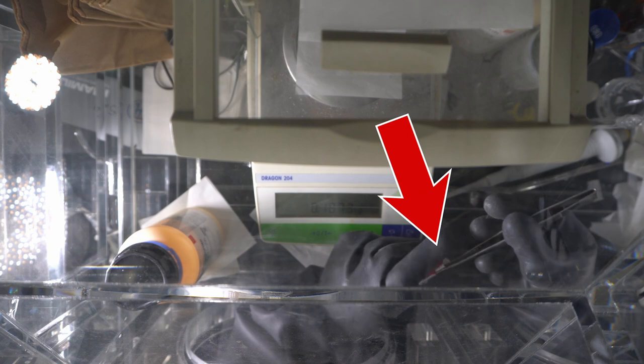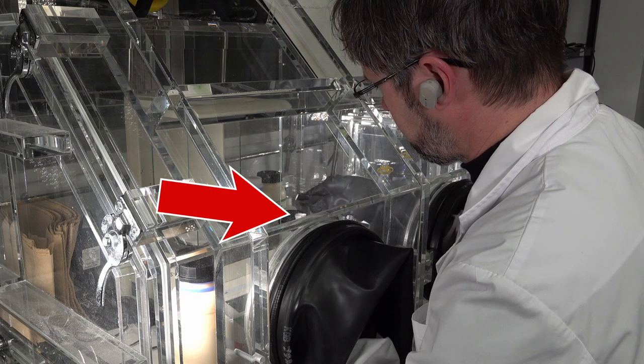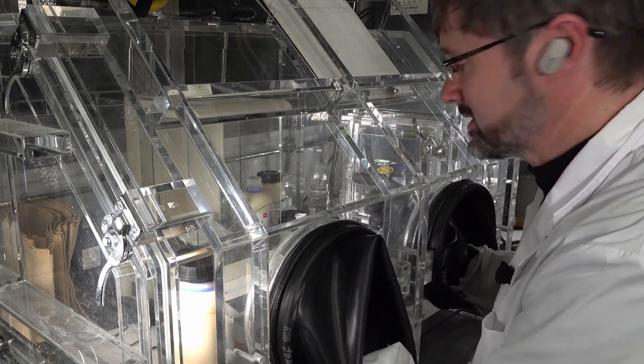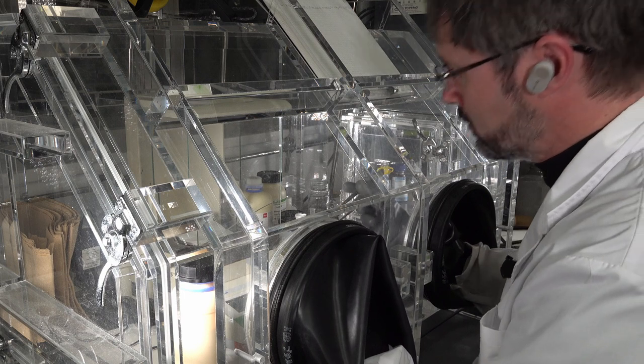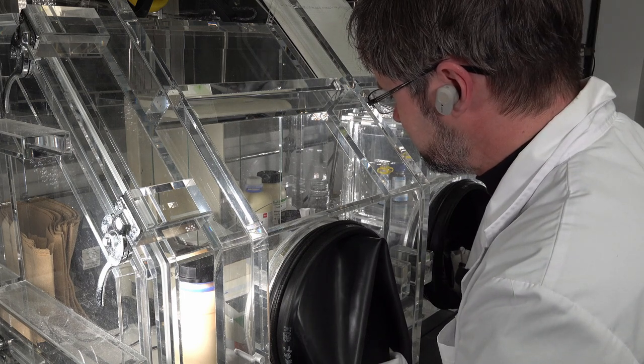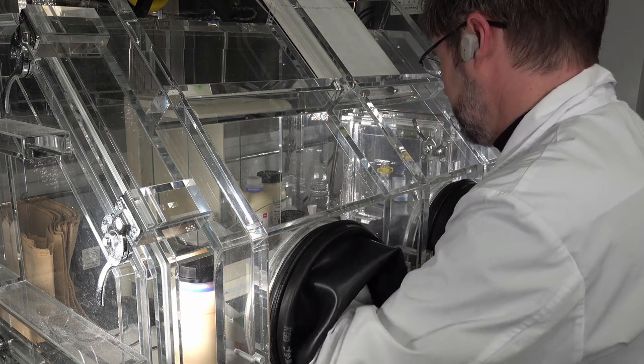I'm gonna use my homemade funnel. I need a funnel that is small enough to fit in the top, also non-sticky, non-slippery, and I find that a weighing paper rolled up like this works quite well. Now if I'm gonna swear, this will be the moment.